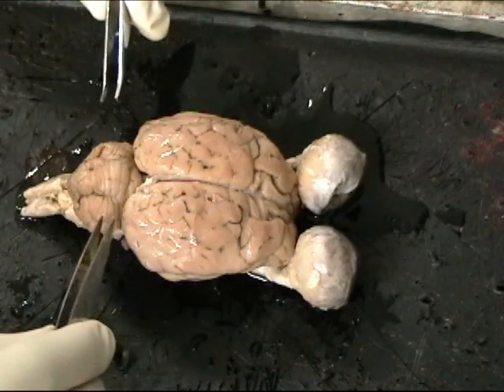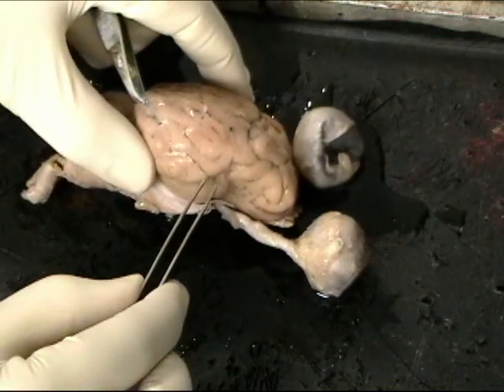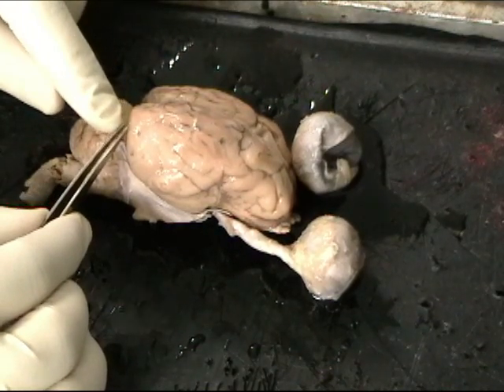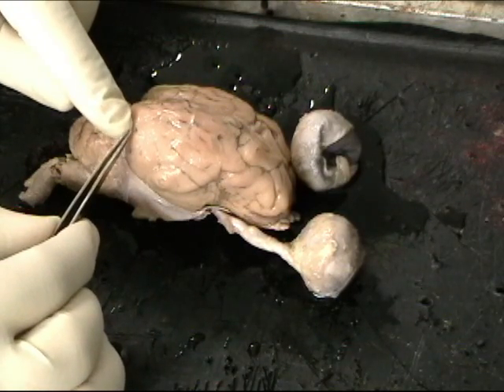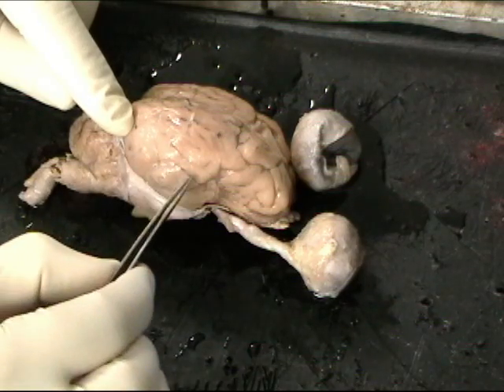Now, let's move down from the occipital lobe to the temporal lobes. We said the occipital lobe has tissue that processes visual information. Visual processing continues down into the temporal lobe. In fact, cells in the visual cortex do send axons to cells on their way down this visual pathway.